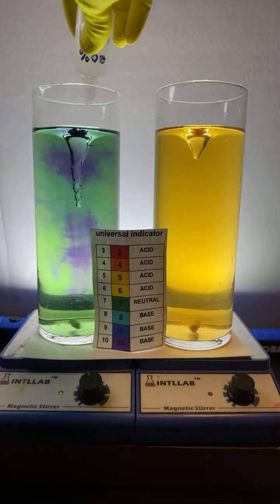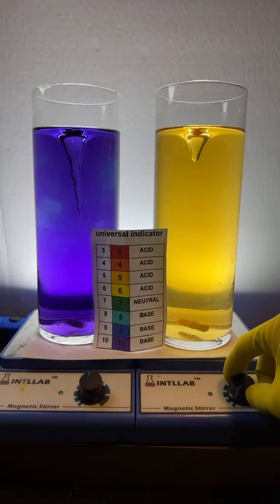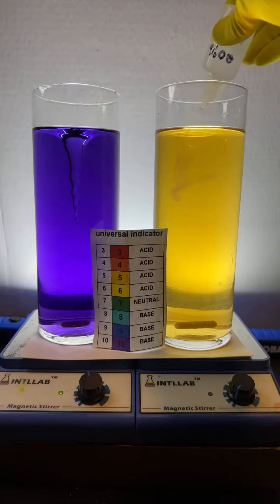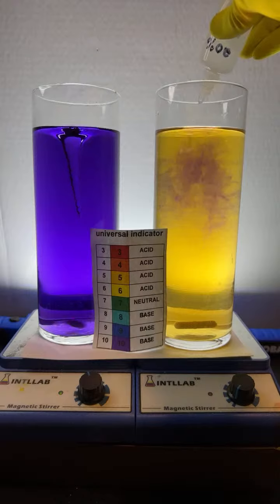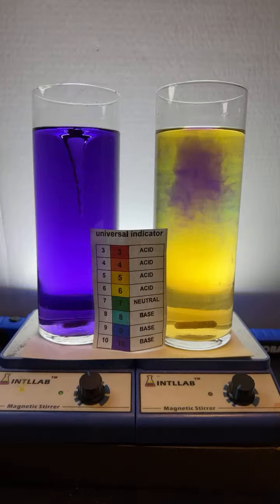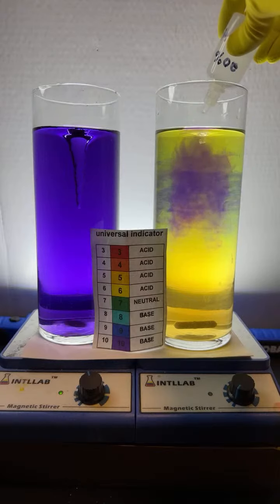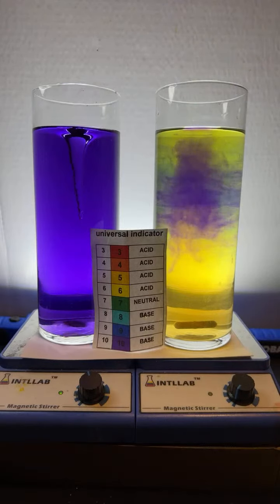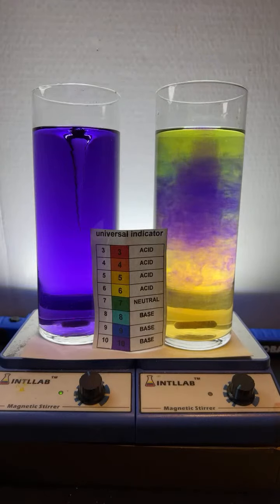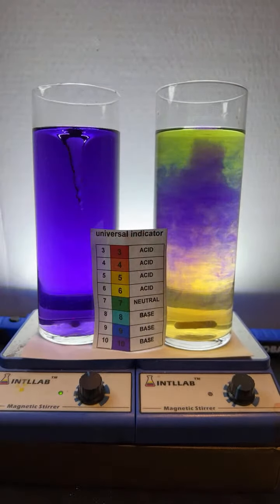Here we go. I'm adding base over here on the left. And then we're going to add base on the right as well. But I'm going to turn the spinner off for a bit here. So here we go. Add some base. What's kind of neat is when you turn off the spin, the stir bar, the solution doesn't homogenize immediately. And because of that, you can get regions of wildly different pH values that persist. Just kind of cool. So right now we've got, what's that, like a pH 10 and a pH 6 all in the same flask.